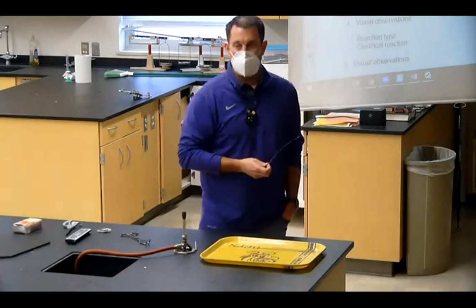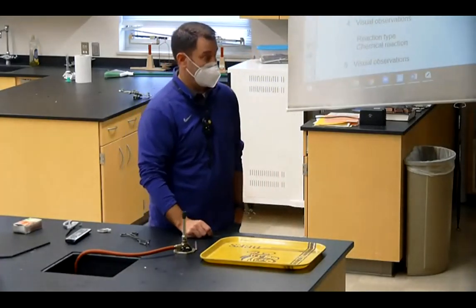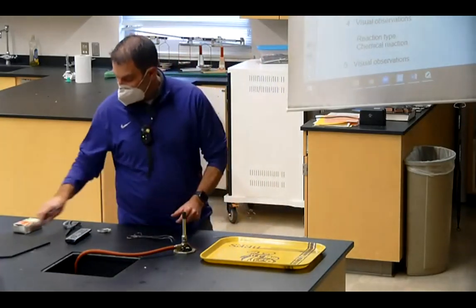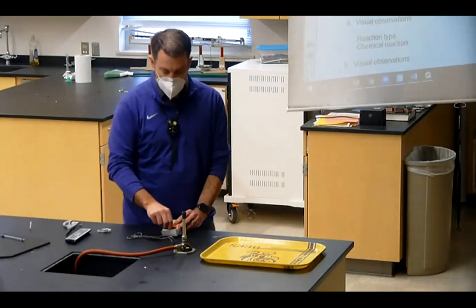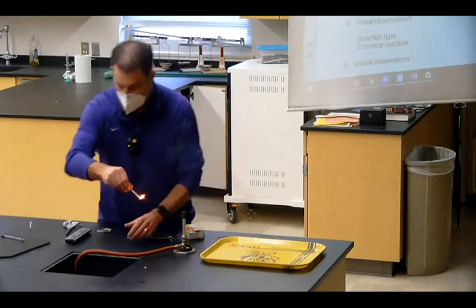Okay, just a 2-year time lapse of it turning grayer. Yep, that'd be fun. All right, guys, let's watch this turn gray. All right, well, instead of that, let's light it on fire. Whenever we burn something, we are simply reacting it with oxygen.